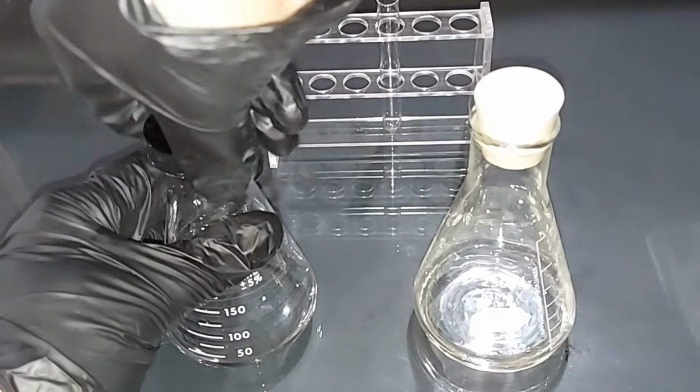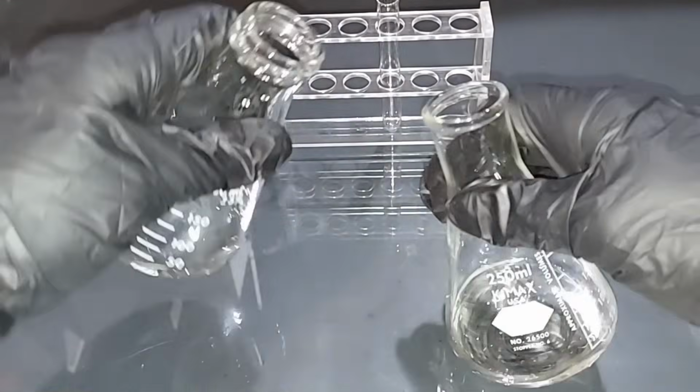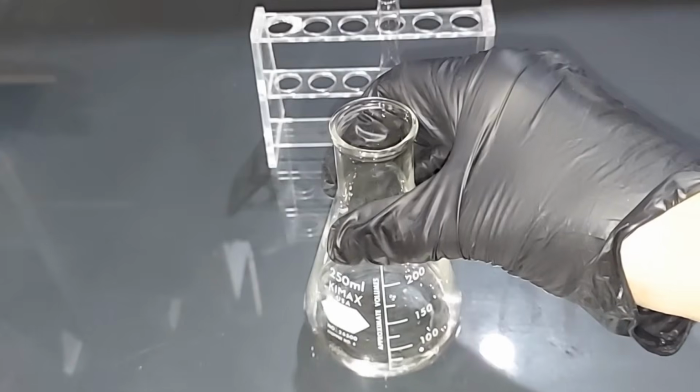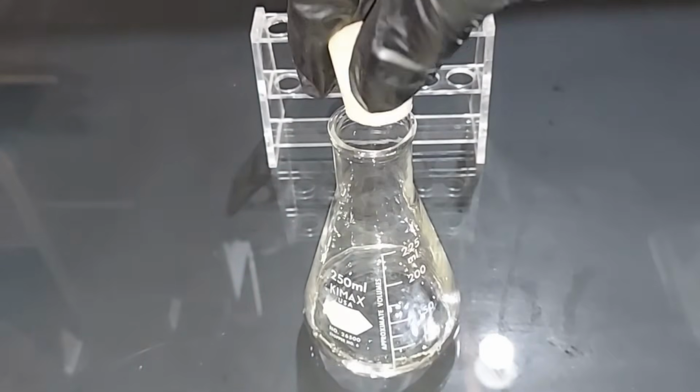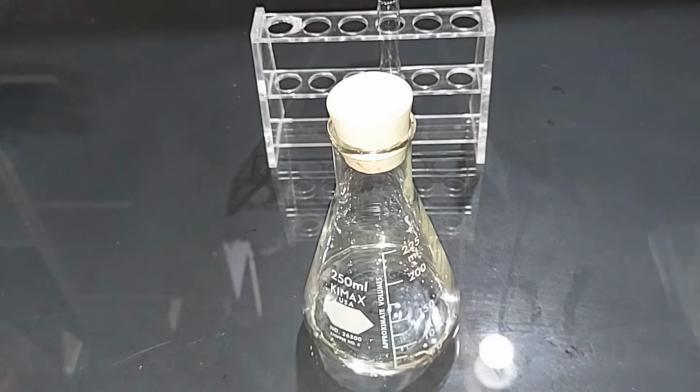I'm going to combine these 2 solutions like I said, and then we're going to test it to see if we have sulfuric acid. So I would say a total of about 60 to 65 milliliters of sulfuric acid. Like I said in the beginning, this is not an economical or even feasible way to make sulfuric acid. It's just for the chemistry.